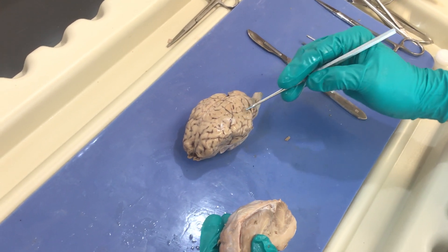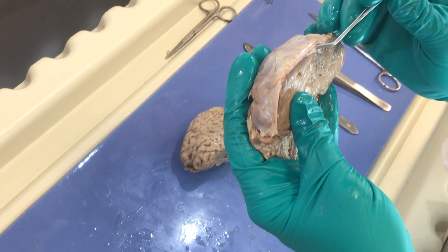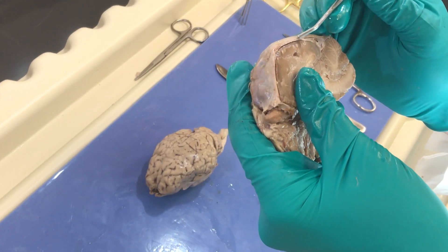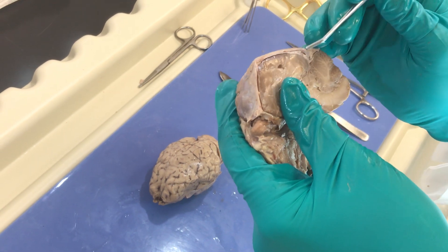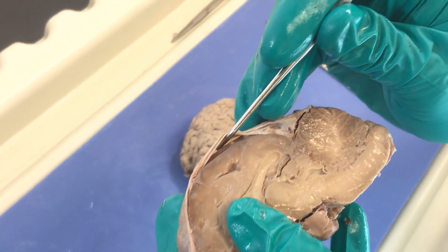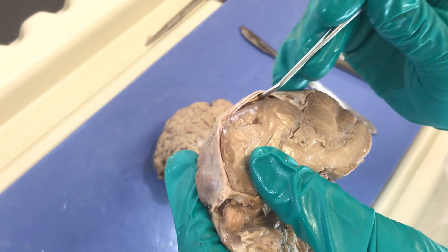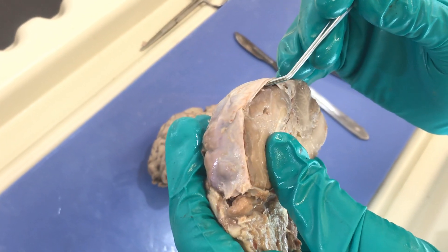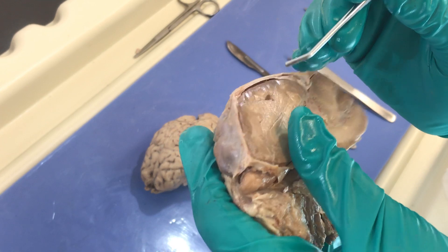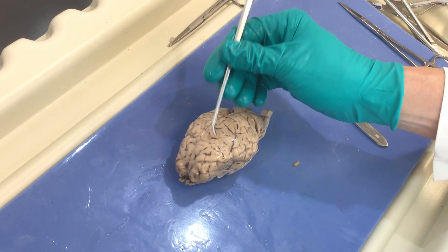The pia mater is very tender, very thin, and directly overlies the nervous tissue. Here you have an example of the dura mater — this stuff right here is super tough. Usually the dura mater and the arachnoid are kind of fused, and you might actually see fibers extending to the pia mater, and that's what we call the subarachnoid space. I wanted to show you this so you can appreciate the dura, the arachnoid mater, and the pia mater.